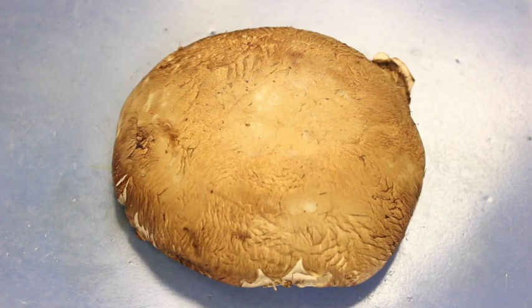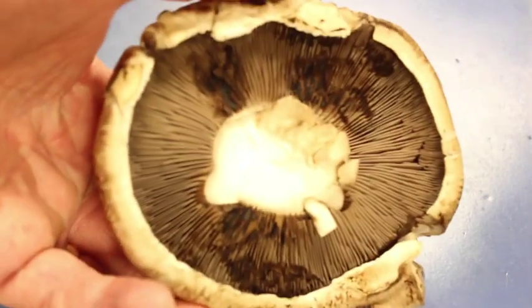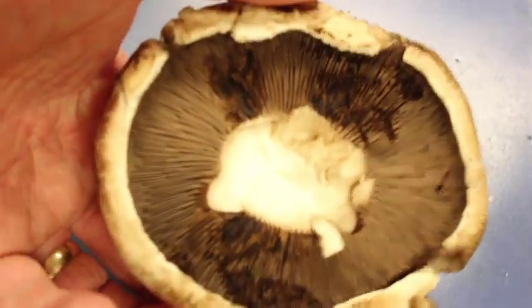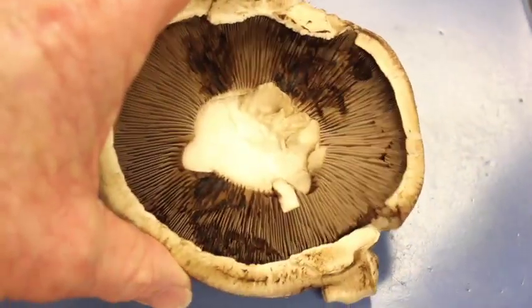Okay, so here we're going to check out the cap of a portobello mushroom. So here's the mushroom. It's really big. And these are good to eat. I just got this one over at Safeway not too long ago, so very good to eat mushroom.